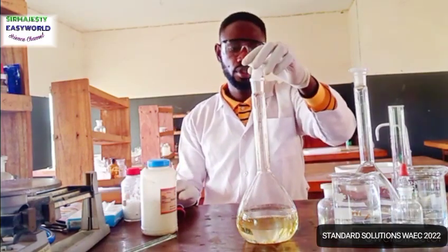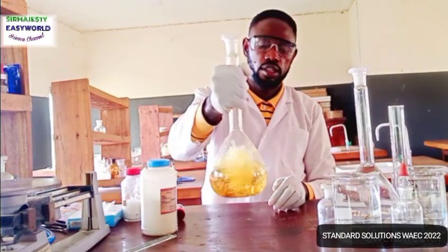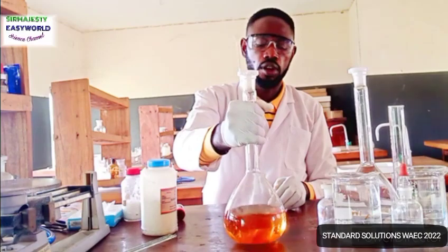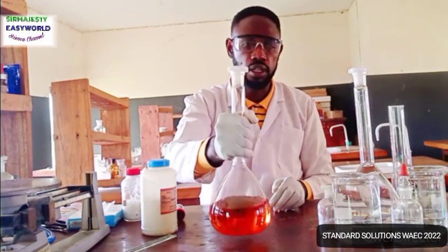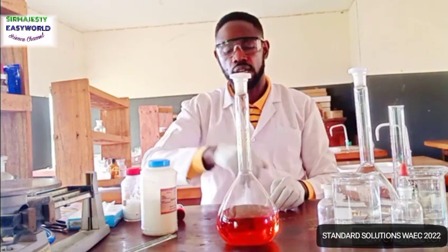So your job is now to close and shake. The dissolving will be gradual, and like I told you, from real analysis, there is no way 6 grams of potassium iodide will dissolve completely 25.4 grams of iodine crystal.